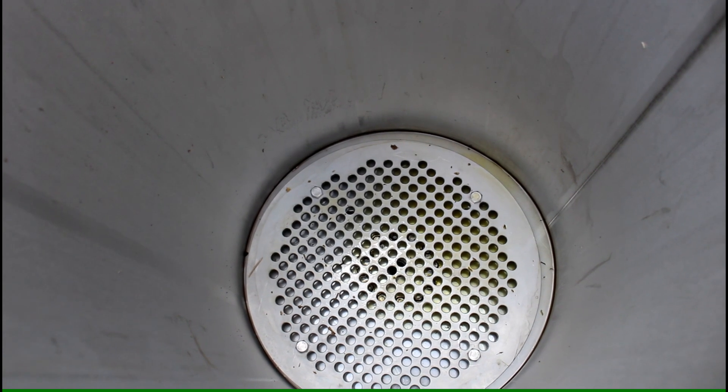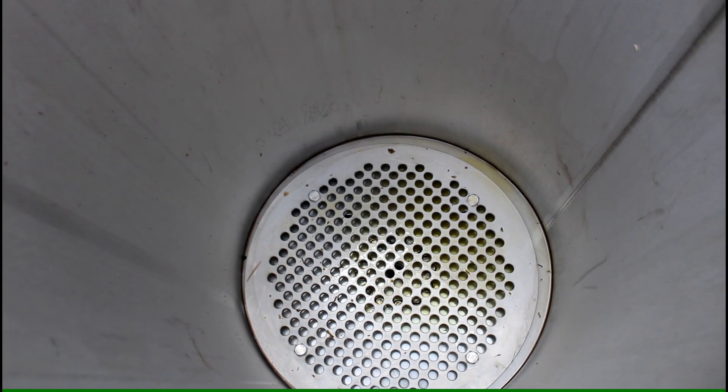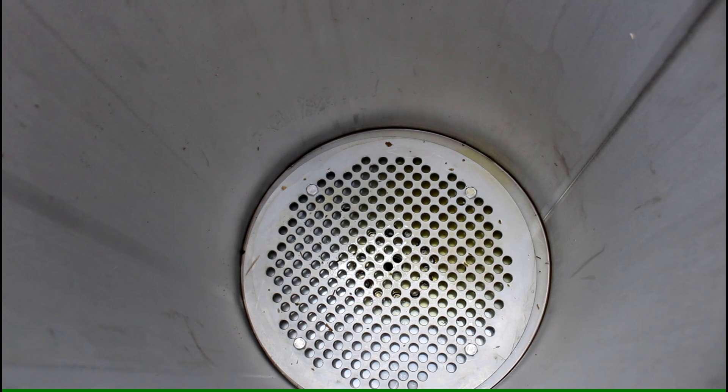So that's why I put these plates there. And with that kind of thing it works much better.